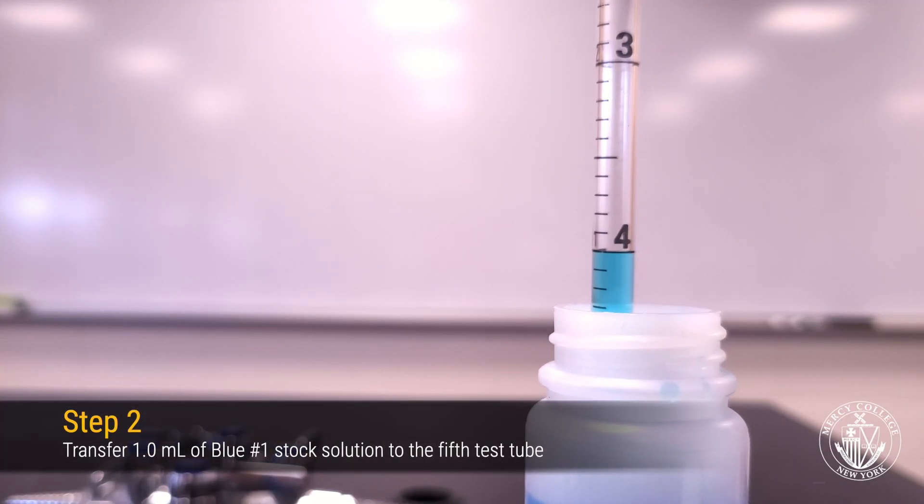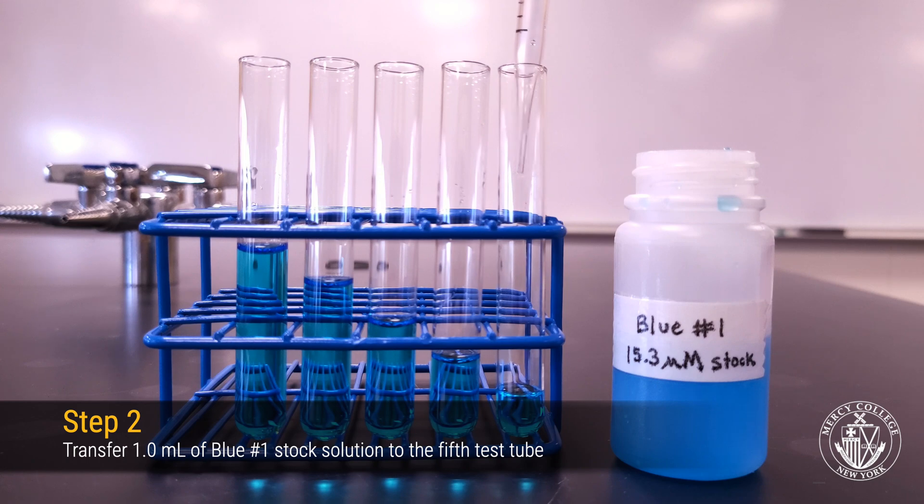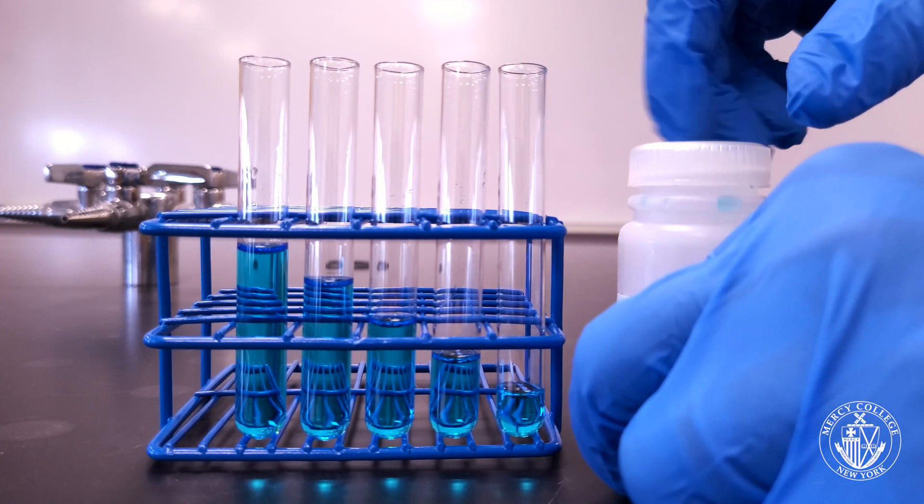And in your last test tube, transfer 1 milliliter of your blue 1 stock solution. Once you're done pipetting your blue 1 stock solution, you can recap the bottle and set it aside.